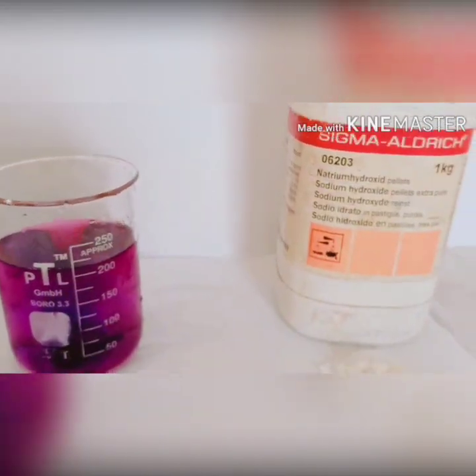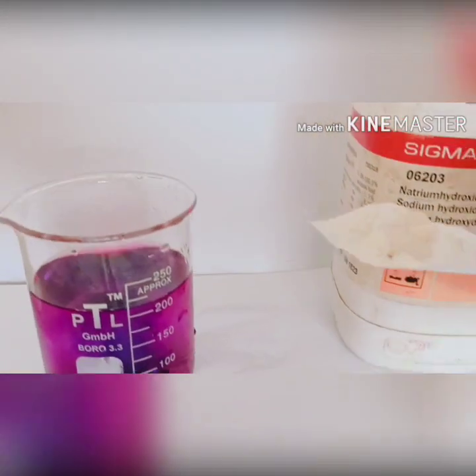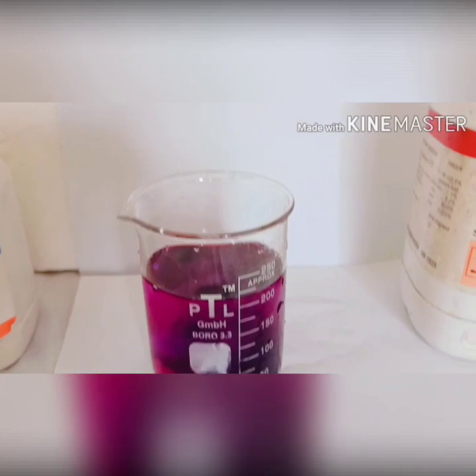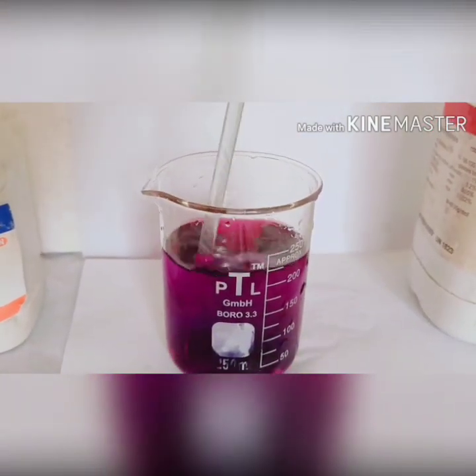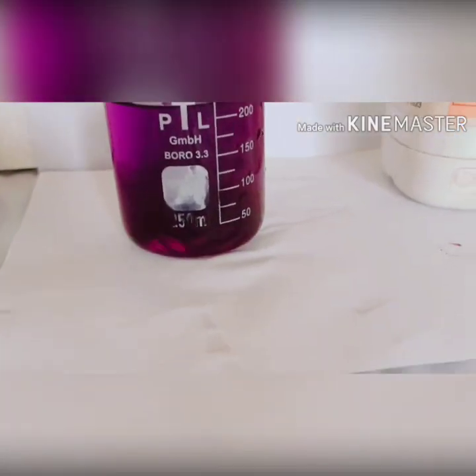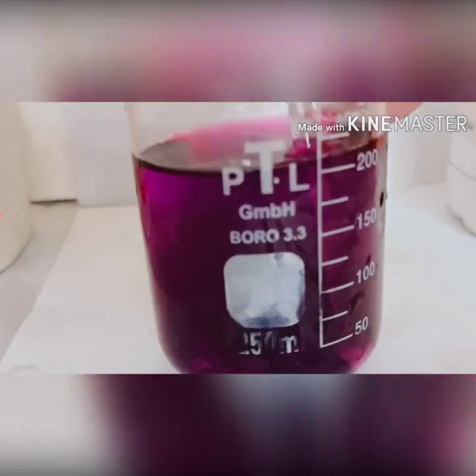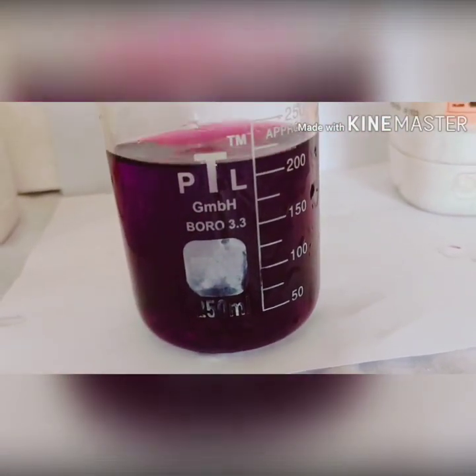Manganese is a transition metal, so its color changes when the oxidation state changes. For this purpose, we will add some sodium hydroxide — caustic soda — into it and stir it very well so that it forms a homogeneous mixture. The color becomes a little bit dark, as you can see — the color is dark purple.